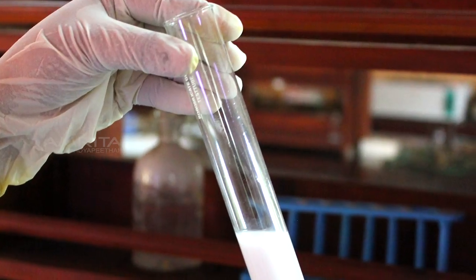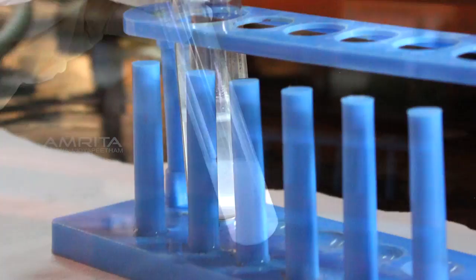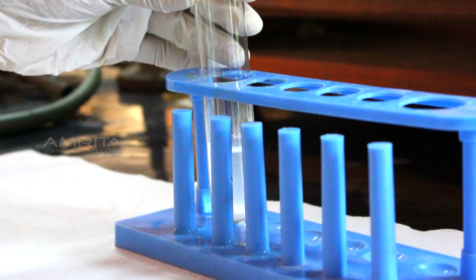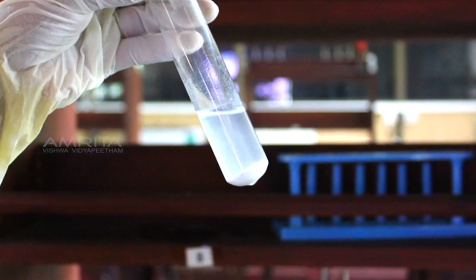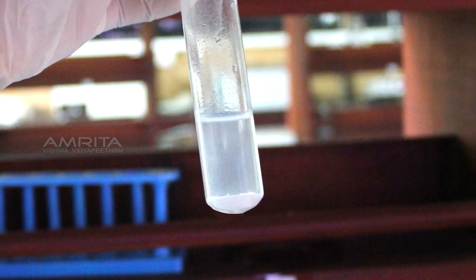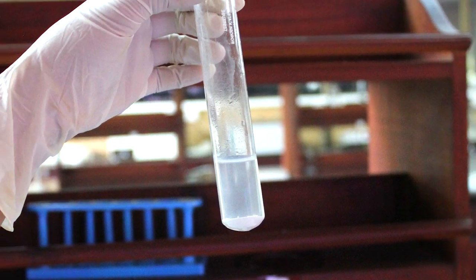Now, keep the contents of the boiling tube undisturbed for 10 minutes. After 10 minutes, we can see that the white precipitate settles to the bottom of the test tube.